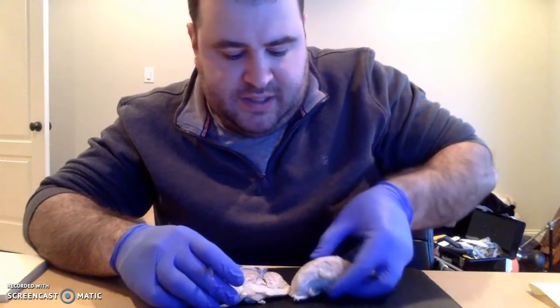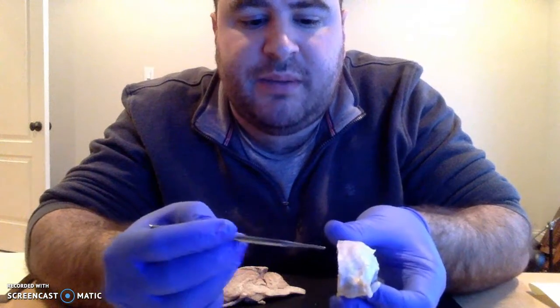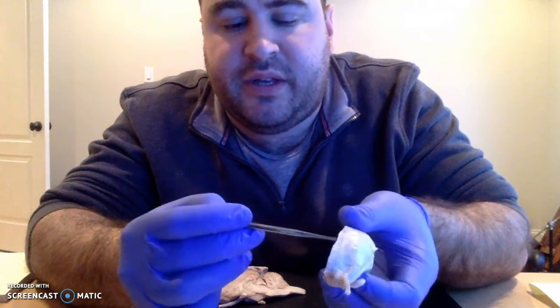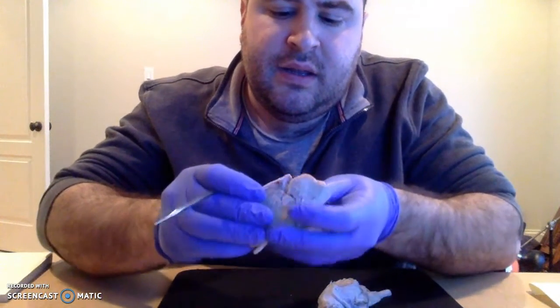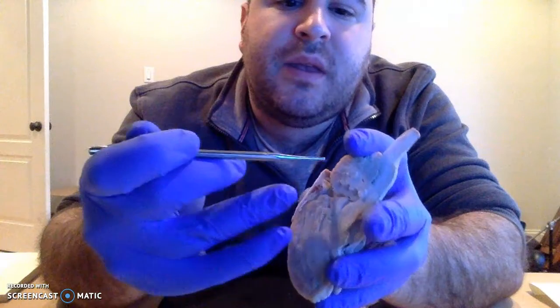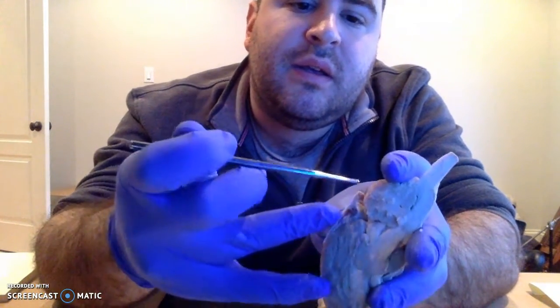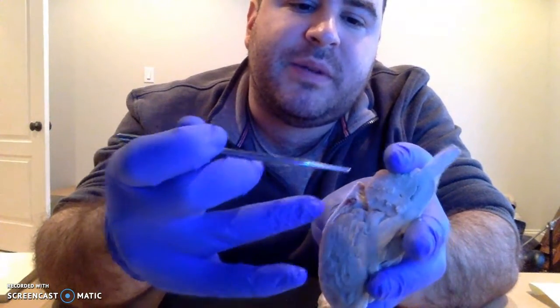And last but not least, we have our meninges. I left them intact on this hemisphere so we get a better view. This very tough fibrous layer, that's the outer meningeal layer, the dura mater. And then on this guy, I don't know if it'll be fine enough to see, but in between this transverse fissure here, the meninges actually penetrate into this and help separate the cerebellum from the cerebrum.